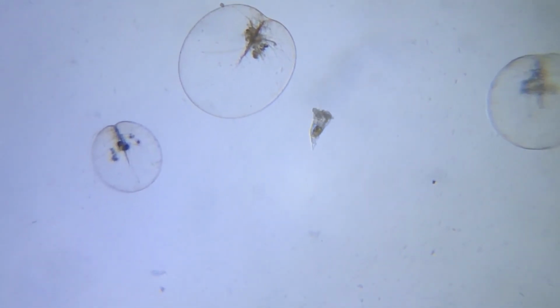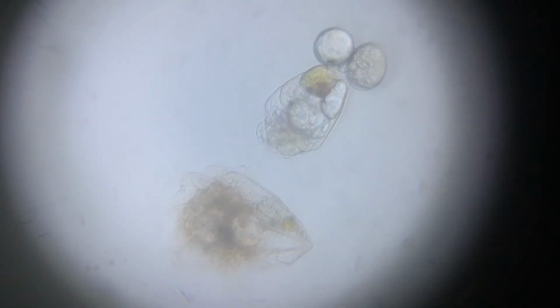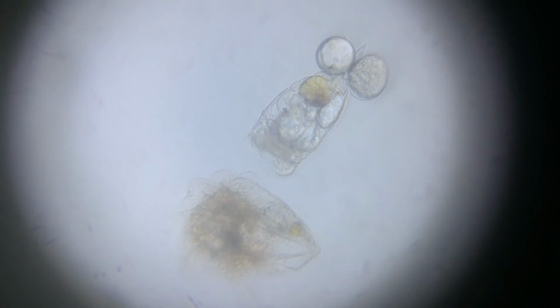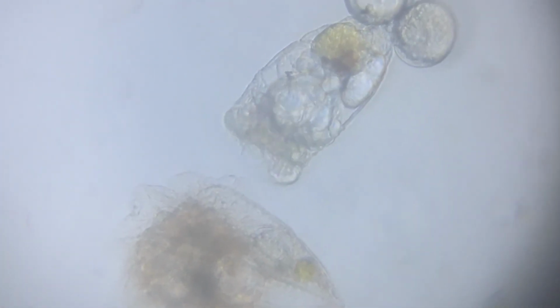And another nice thing about this microscope is that in the next iteration I may include fluorescent microscopy, which is when you use glowing antibodies that attach to specific biological markers. Now imagine overlaying that information on top of the light microscope image and then feeding that into a machine learning algorithm. It makes it possible to get a very accurate identification.